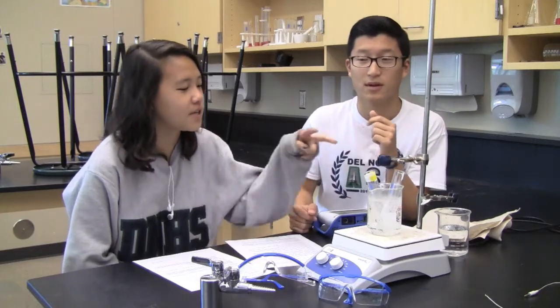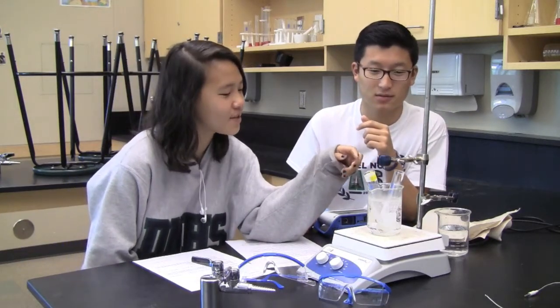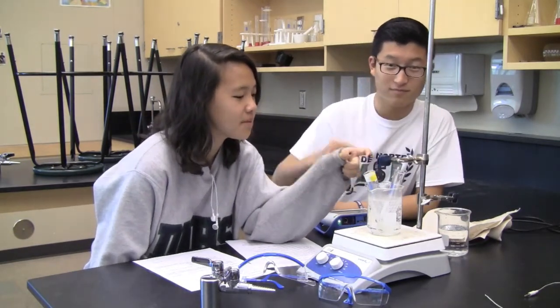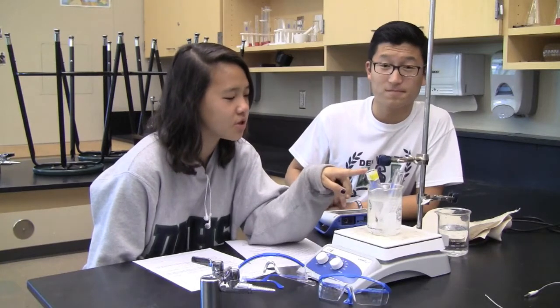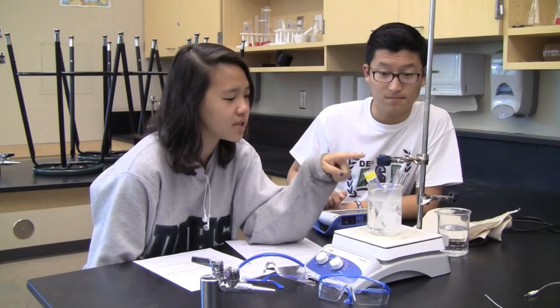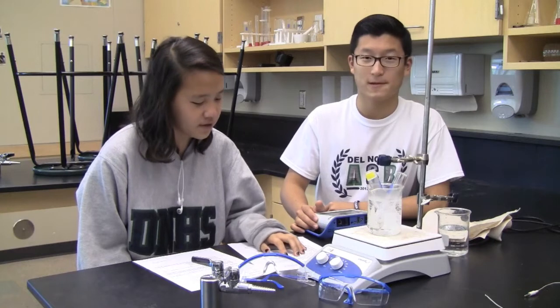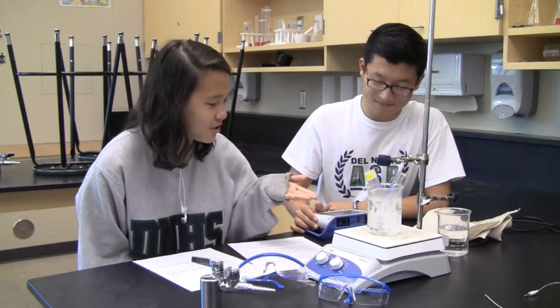In these two test tubes, we have a pure lauric acid sample and a sample mixture of lauric acid and citric acid. Practically, this lab is used to determine the freezing point depression of both these samples and at what temperatures they freeze. So we are going to find the freezing point depression of this mixture.